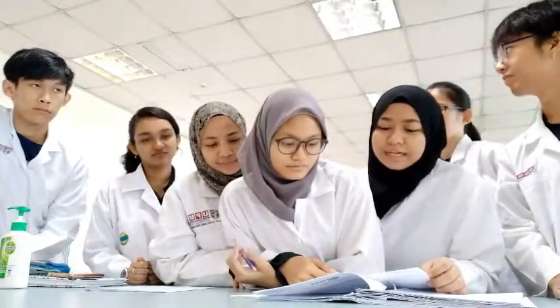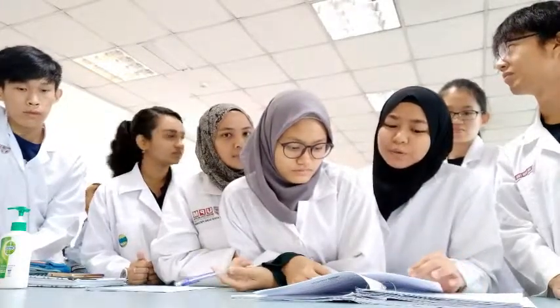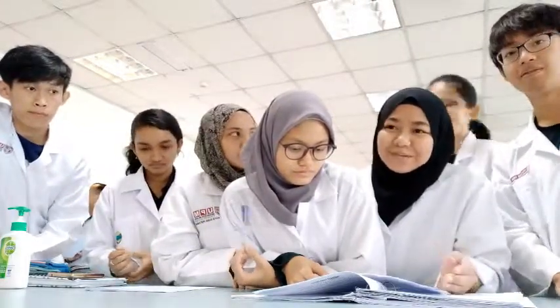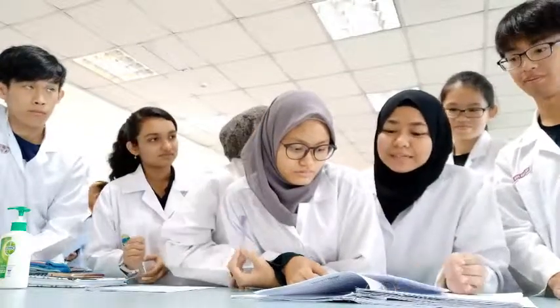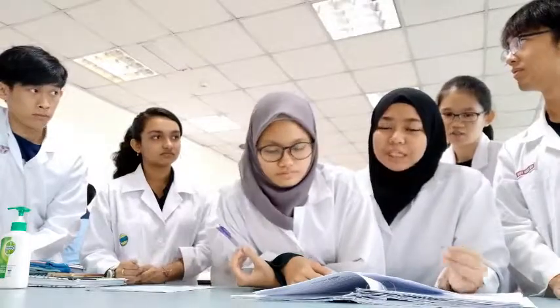And for specimen X, we obtained a green color when we underwent the Benedict test. It indicates the presence of glucose in specimen X at a concentration between 0.5 to 1%. So this means that in specimen X, the person has diabetes, but the presence of glucose is quite low. This is because maybe the patient undergoes medication and also takes insulin injections.